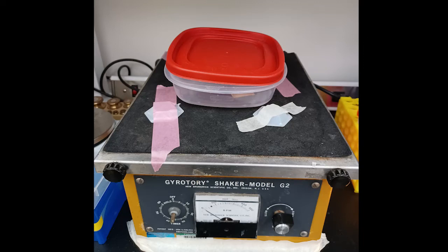When you arrive, you'll see this Tupperware container on top of the shaker. The three net wells that we'll be using are located inside.